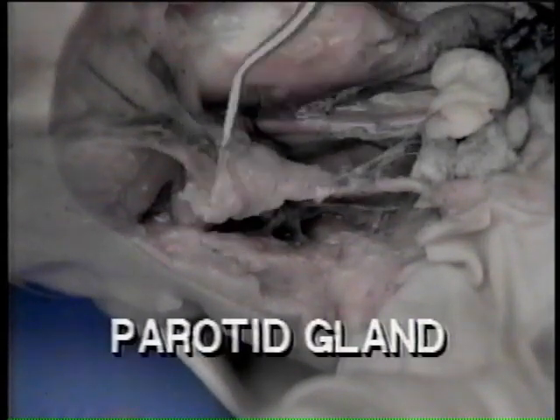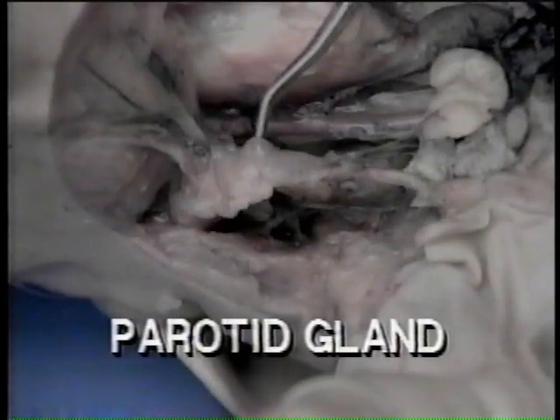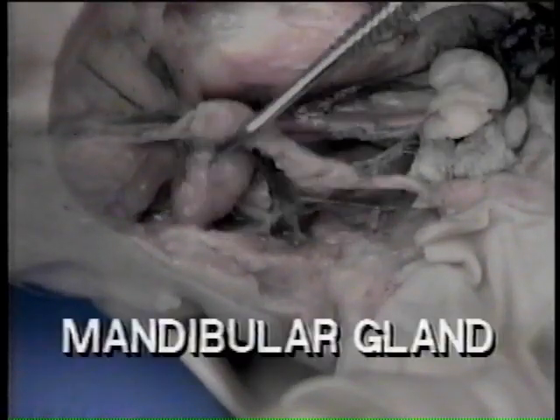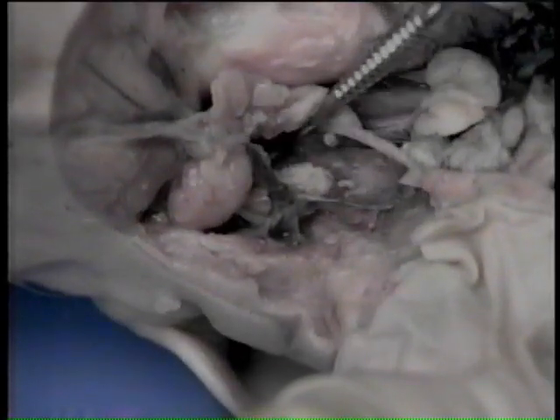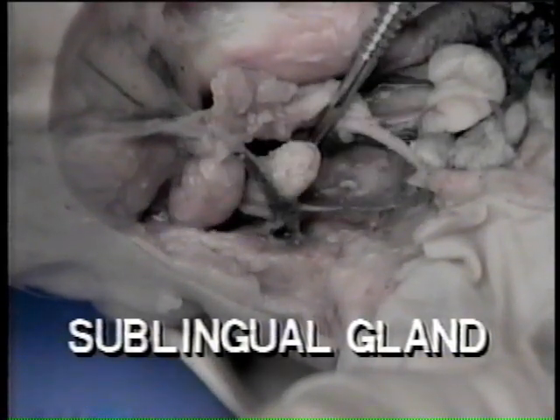This is the parotid gland. Note that it is composed of many small nodules. The mandibular gland is comparatively large and somewhat lobed. The sublingual gland is behind the mandibular.